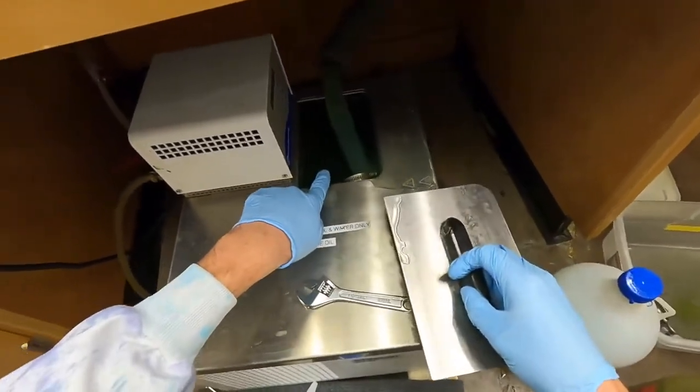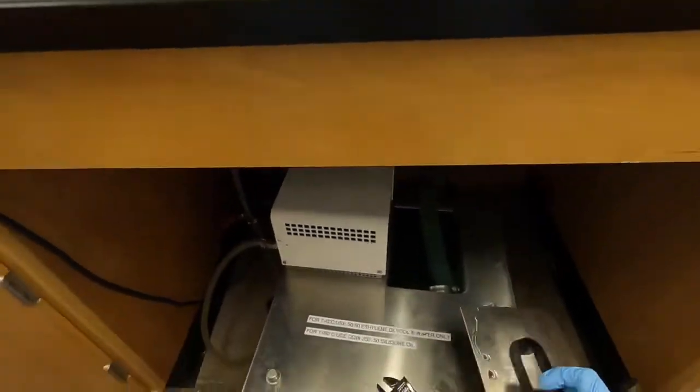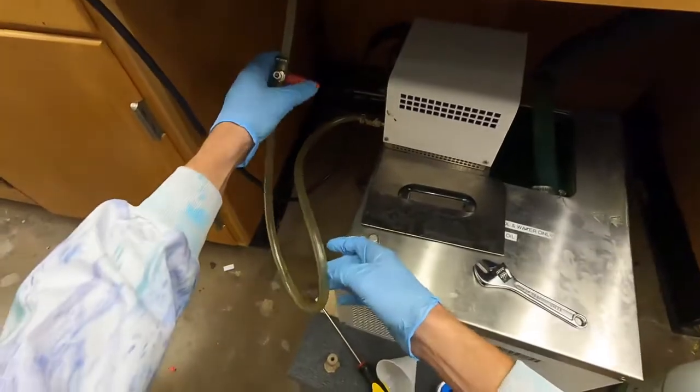This is where you'll be filling the antifreeze. As you turn it on, this will start draining, so it'll start cycling up through the bucket up here. To turn it on, you want to make sure this is open.